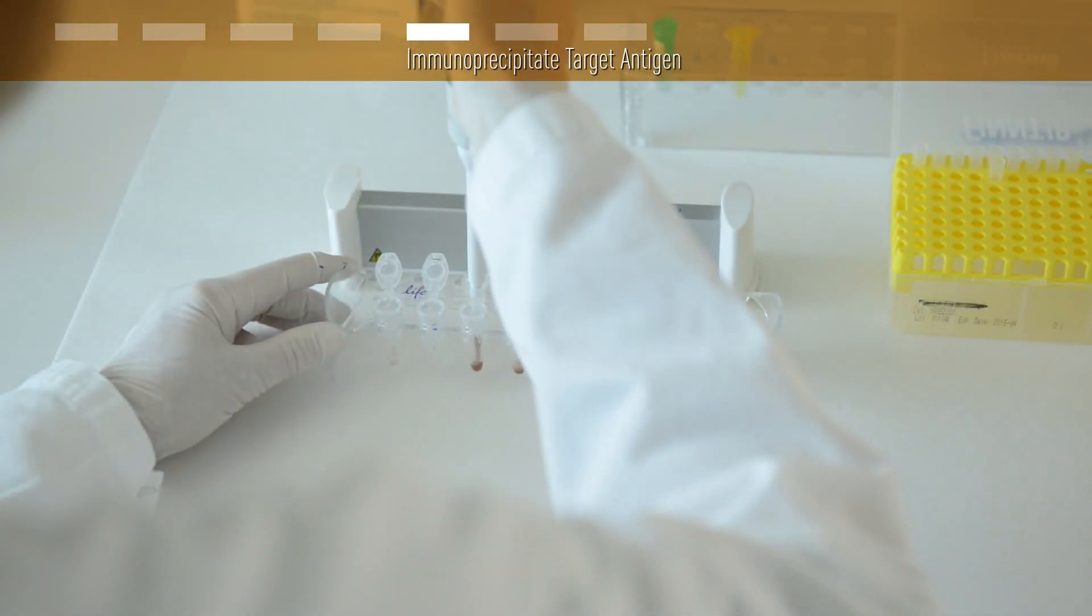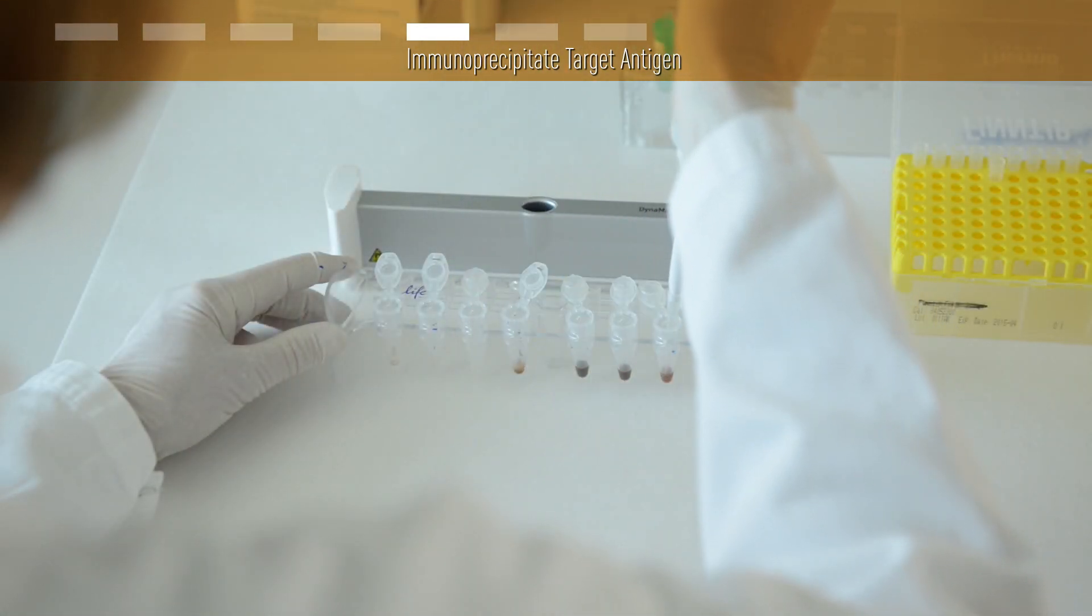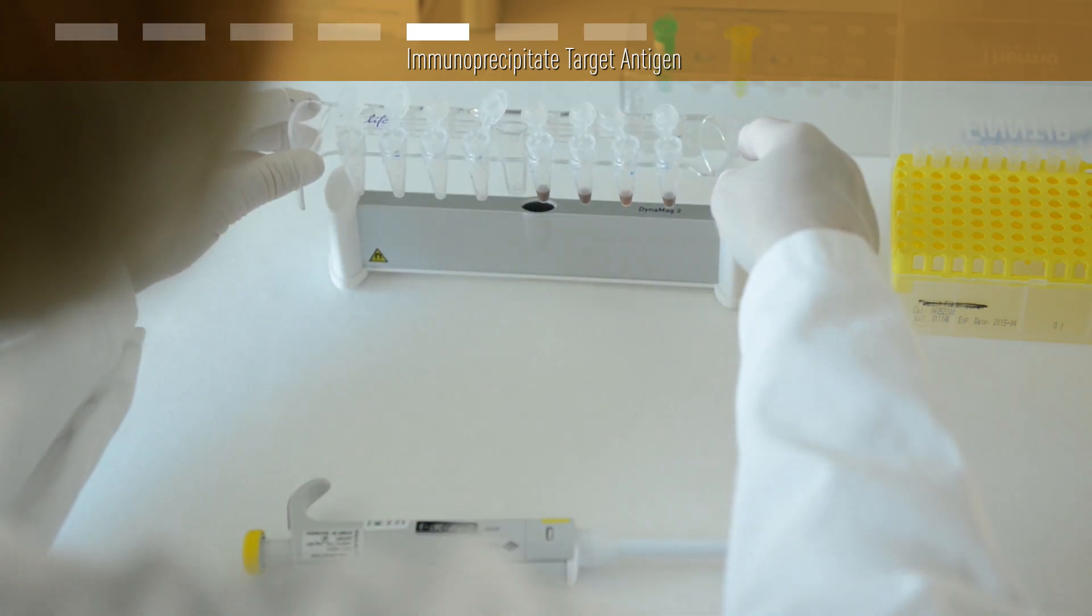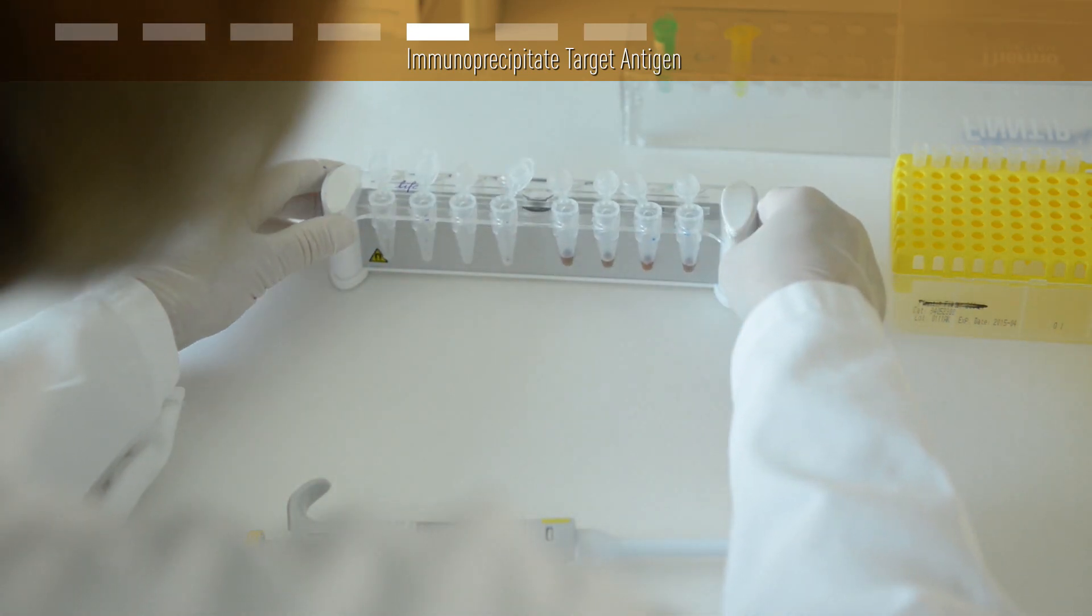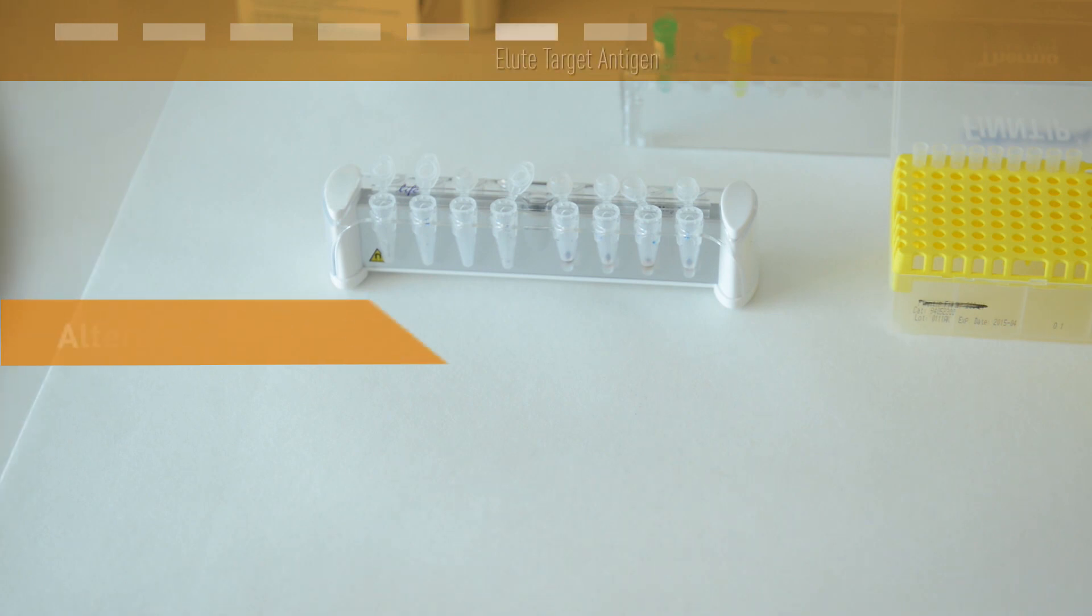We recommend to transfer the beads to a clean tube for the final washing step. This way you avoid any carryover of contaminants bound to the tube wall or the cap. Now you have a couple of choices.